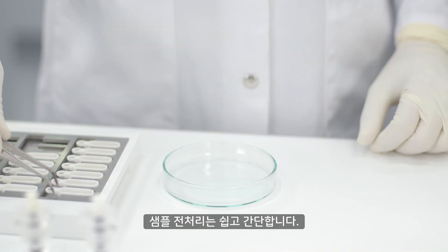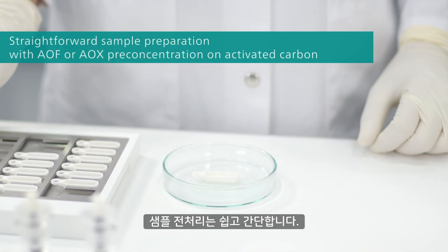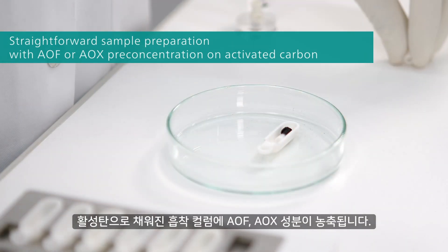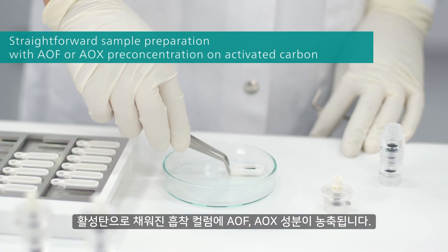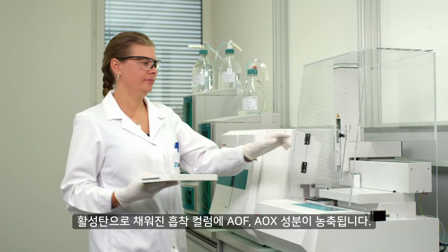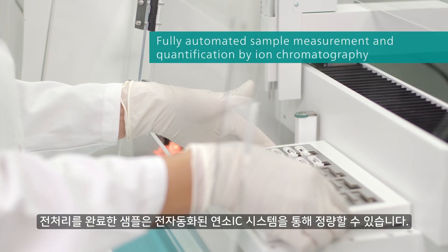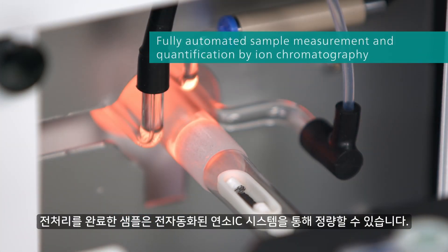The sample preparation is straightforward and easy to handle. AOF or AOX are pre-concentrated on adsorption columns filled with activated carbon. Combustion and quantification by combustion ion chromatography is fully automated.